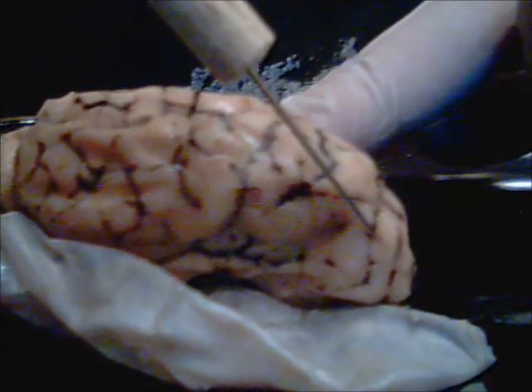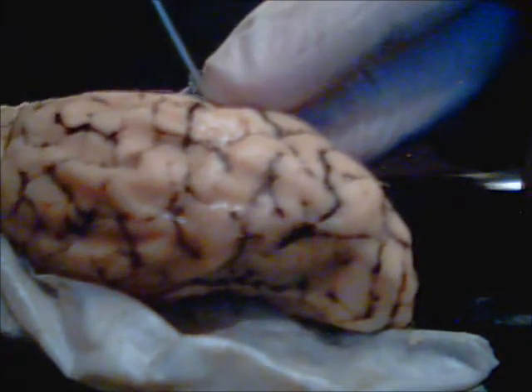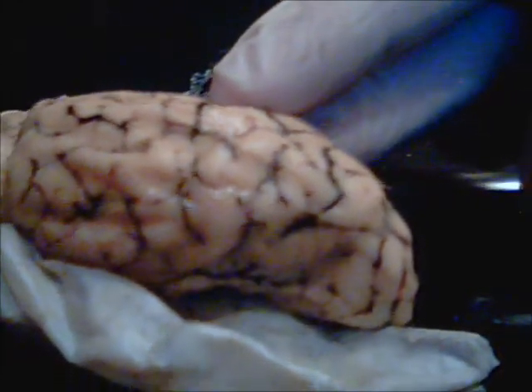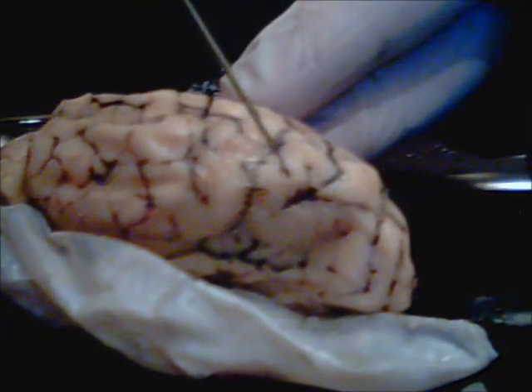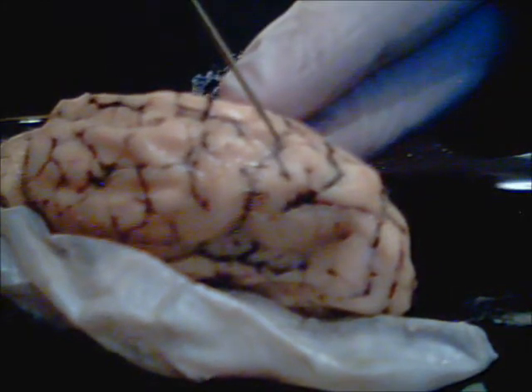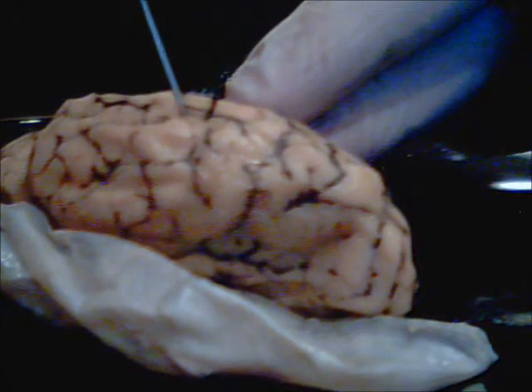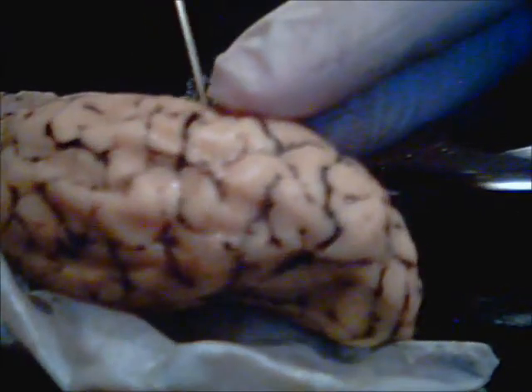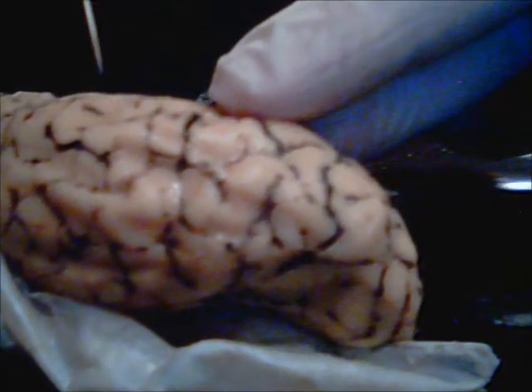And we have, let me see. Wait, let's do a sulcus. Here's a sulcus. One of these guys. And the gyrus. These guys are the raised ridges. The sulcus is the depressions. Or supposedly. I guess this got vacuum sealed too well, so it's hard to tell the difference.